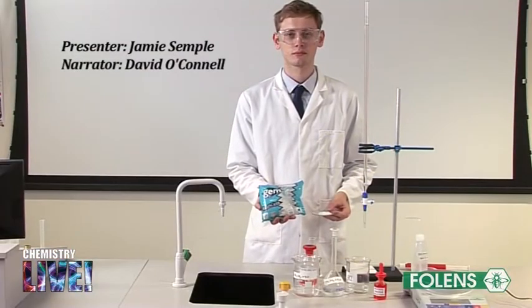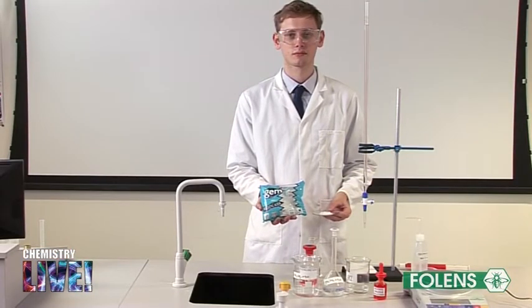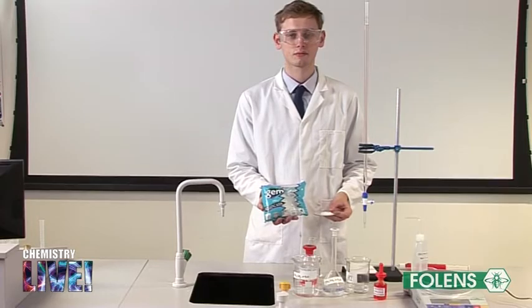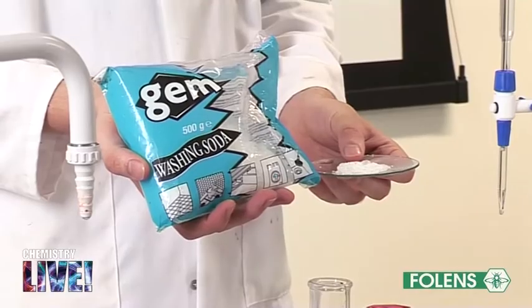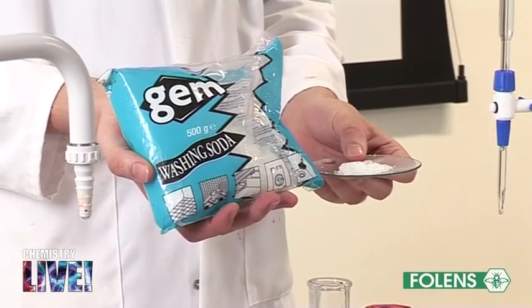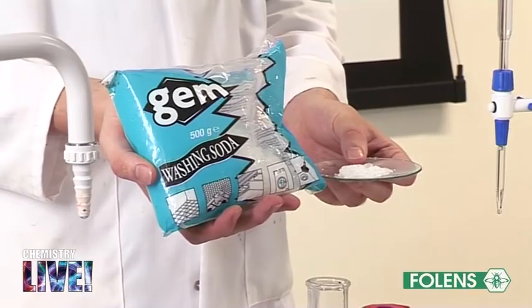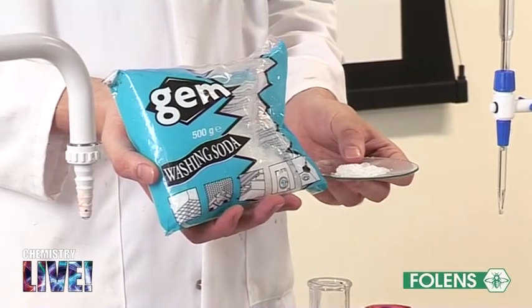Experiment to determine the percentage of water of crystallization in hydrated sodium carbonate, washing soda. Washing soda is made up of hydrated crystals of sodium carbonate, that is, crystals in which water makes up part of the crystal structure of the compound.